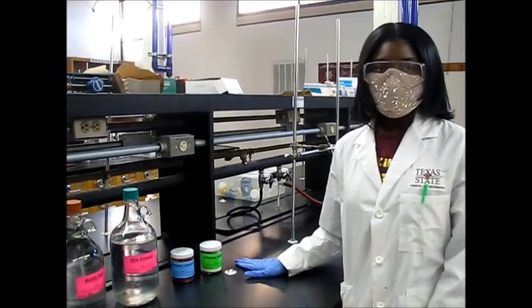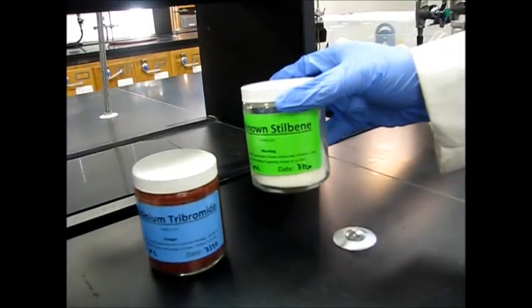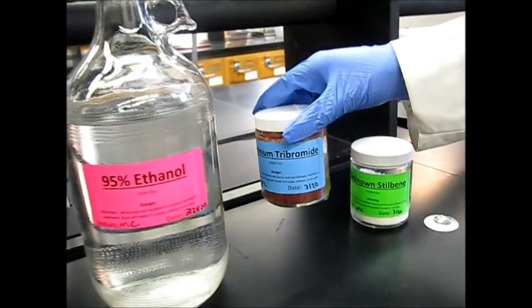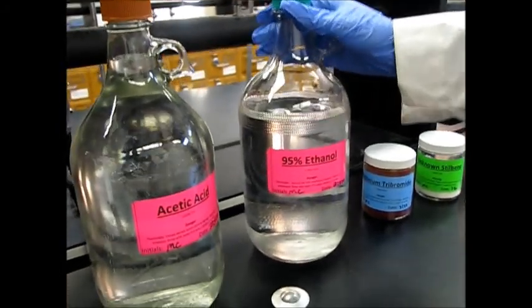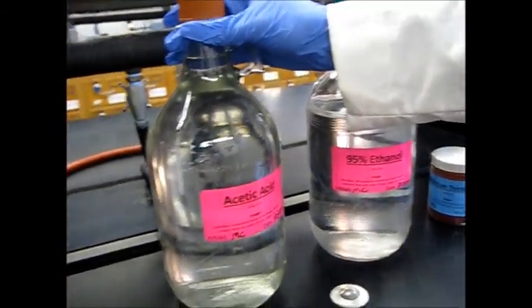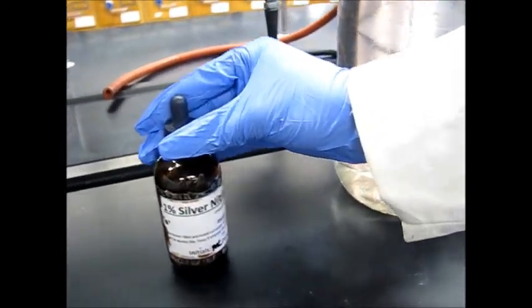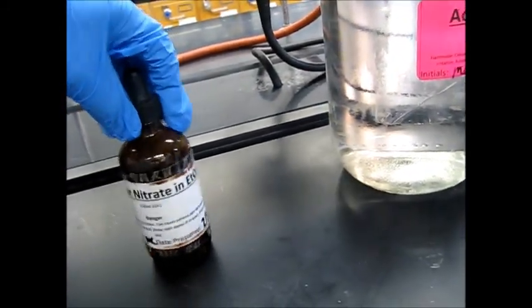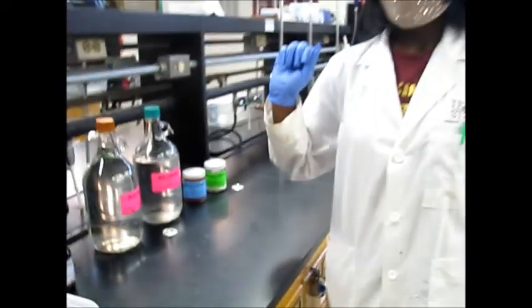These are the chemicals we will be using for our bromination. These are our reagents. This is the stilbene. This is pyridinium tribromide, which is the stable form of bromine. These are our solvents, 95% ethanol and acetic acid, and this is our silver nitrate solution, 1%, that we will be using. So this is an ethanolic solution of silver nitrate. So we use this for a halide test.